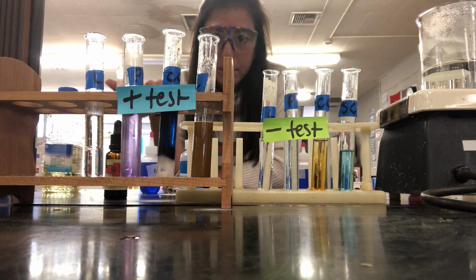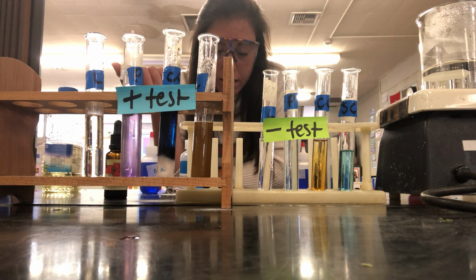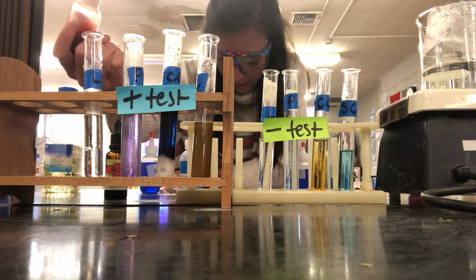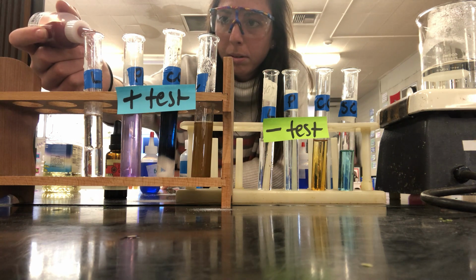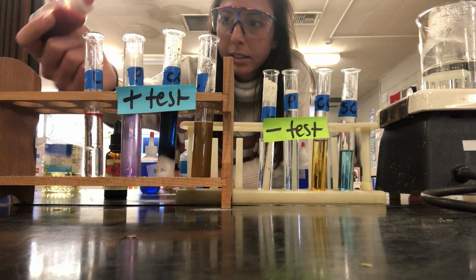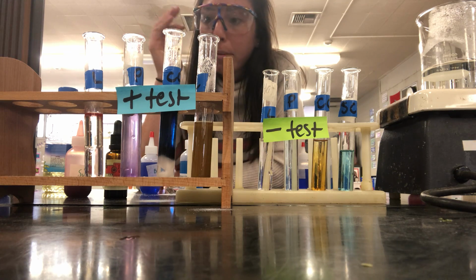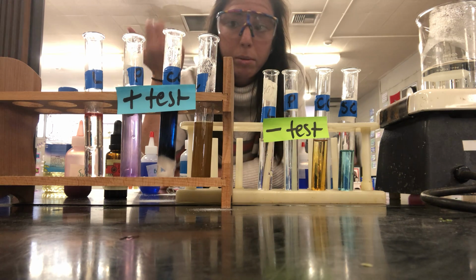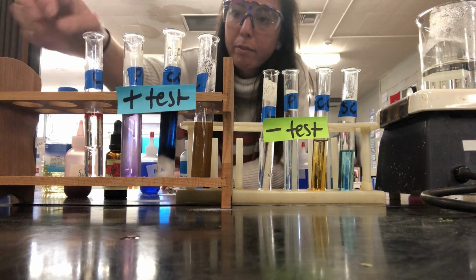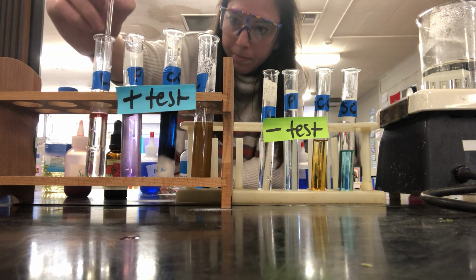So for lipids, if there are lipids, like things like butter or things like oil in Harold's stomach, then this is what you will see when you add the Sudan 3, 6 drops of it, to your test tube. 1, 2, 3, 4, 5, 6. So this one also says to cover with your thumb and shake it. Again, I'm going to leave gloves out so that you don't get this stain all over you, and your thumb is not red for the rest of the day. For my purposes right now, I have a stir, so I'm just going to go ahead and give it a little stir.